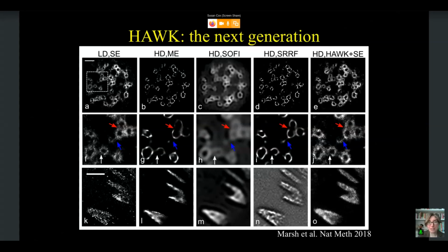And for the middle, for SOFI, you can see here the structure looks more similar, but we are missing some of those fine structures, and we are also getting some background structure which isn't really present in the actual sample. So we thought this was really interesting and revealed some issues.